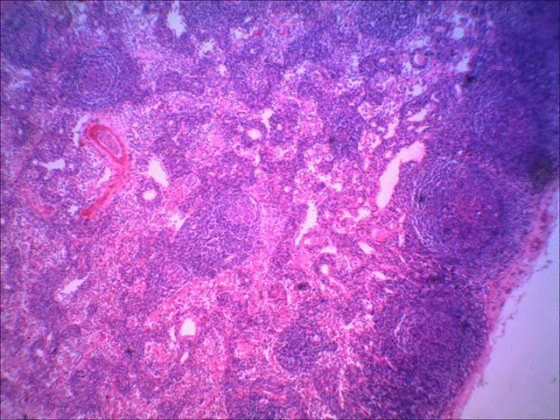All right, this first slide we're going to see is of a lymph node, and this particular slide is on scanning, which is the lowest power of the microscope. If you'll notice where I've got the arrow, there you can see the fibrous capsule. That's on the outside of the lymph node. And then on the inner part, let me erase these arrows.